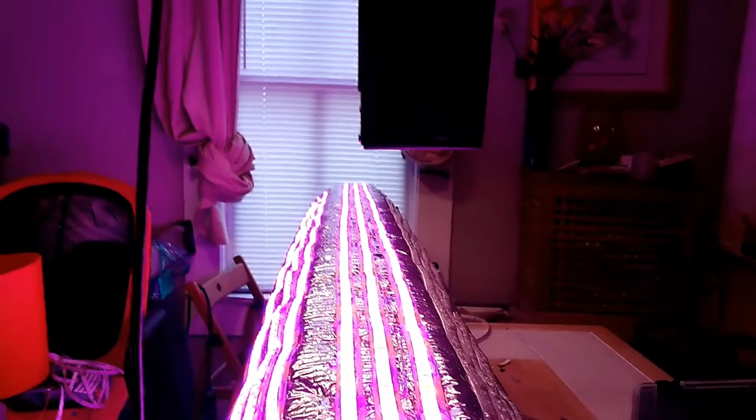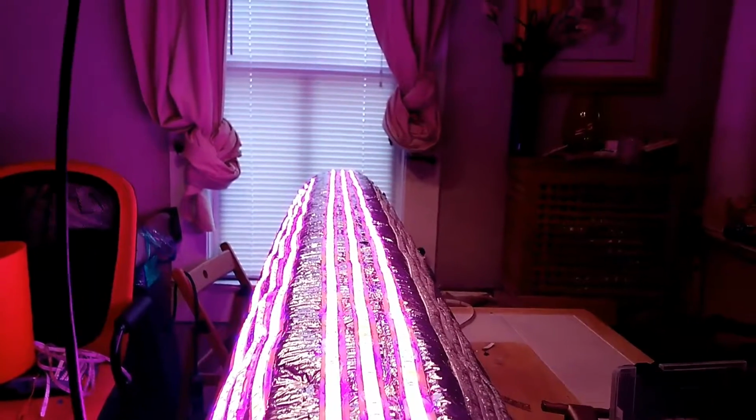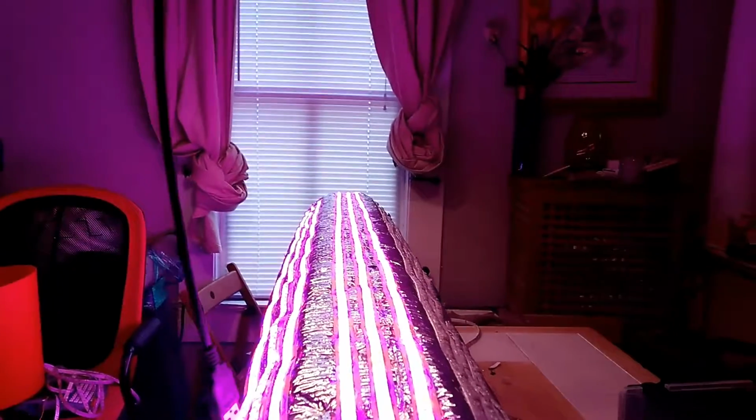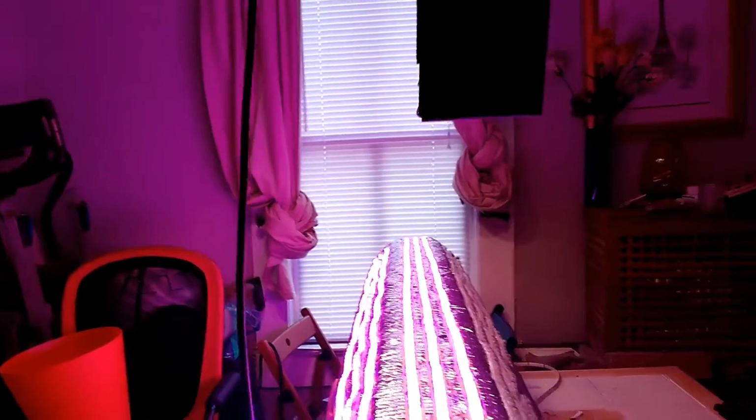So once I get my little piece done, God, that light doesn't hurt, but it's just weird when you turn away to regular light. It looks almost kind of like yellow gray. But once I put this in here and calibrate it properly, then I can actually measure the strength of what band of light gets at each distance. So I'll be able to calculate as the plant grows how much energy it's getting. I'm going to build a thing to hold it and then adjust it at different levels, and then that way I can calculate it.